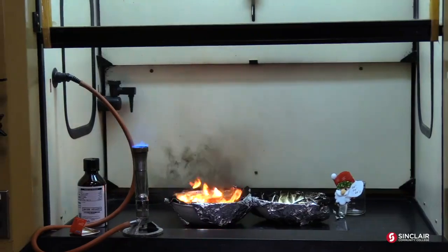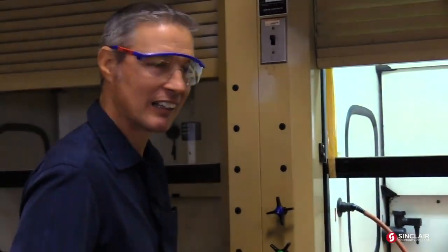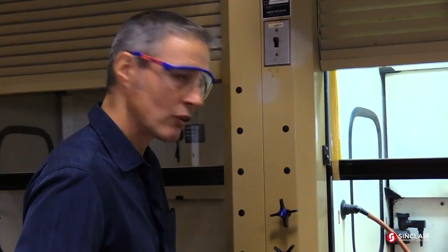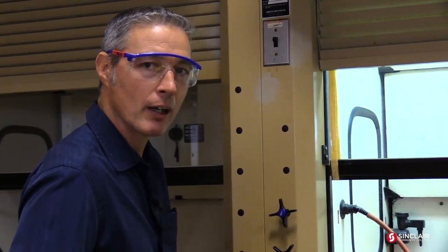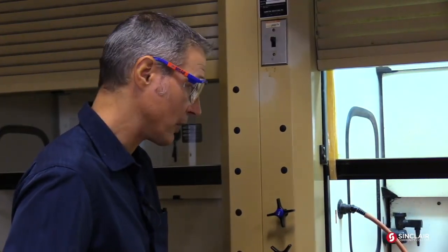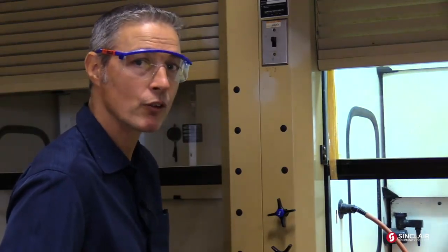Actually, if you've ever seen tires burn. When tires burn, it's like that. Really nasty. And, you know, buses and trucks, they've cleaned them up a lot. But they used to burp out lots of this stuff. And that's because quarter of diesel is, you know, things that are derivatives or are naphthalene.